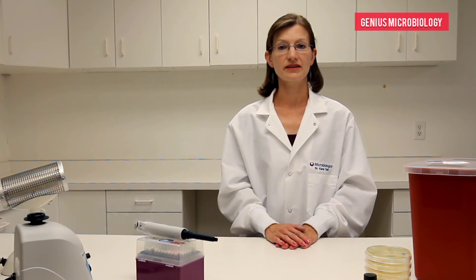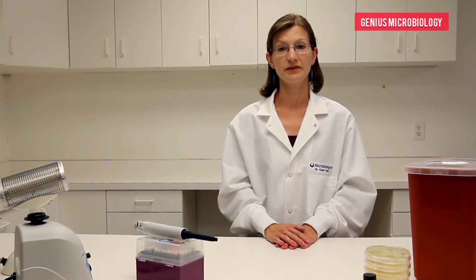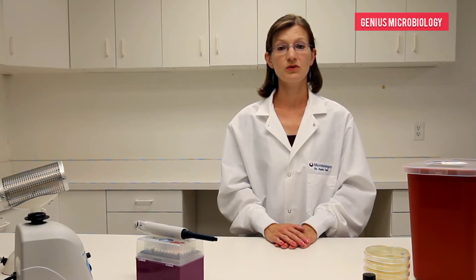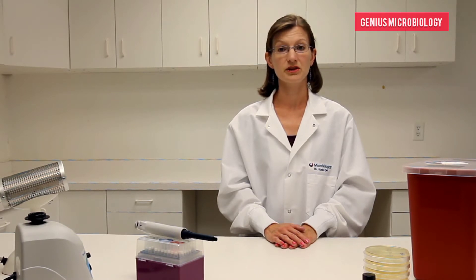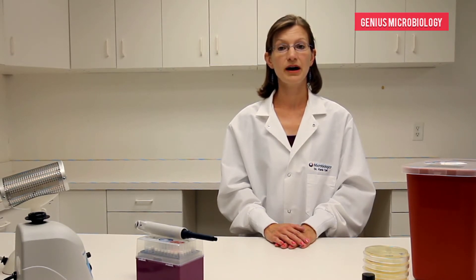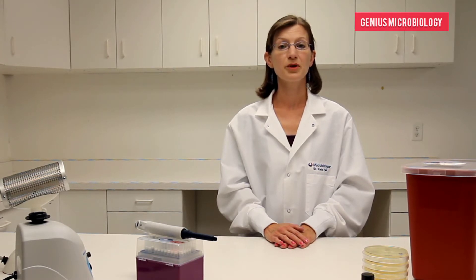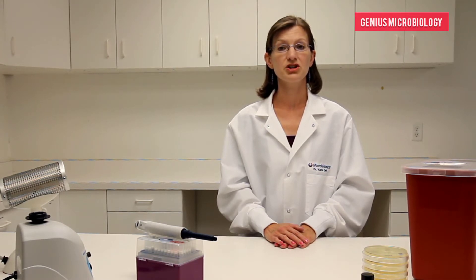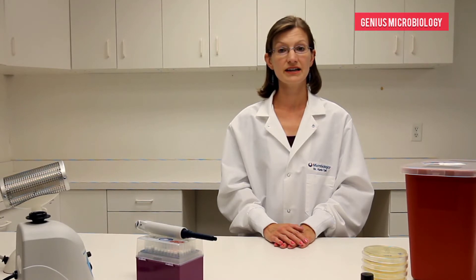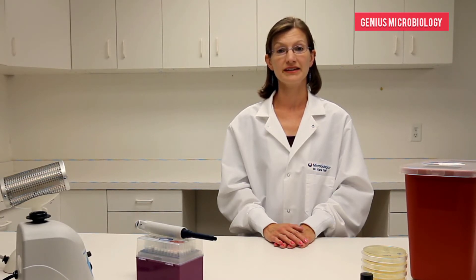Dilution is the process of making a solution weaker or less concentrated. In microbiology, serial dilutions, or log dilutions, are used to decrease a bacterial population to a required concentration. The purpose is to achieve an appropriate concentration for a specific test method or to achieve a countable agar plate.